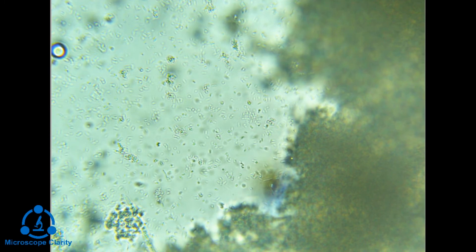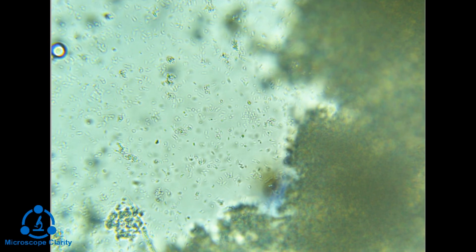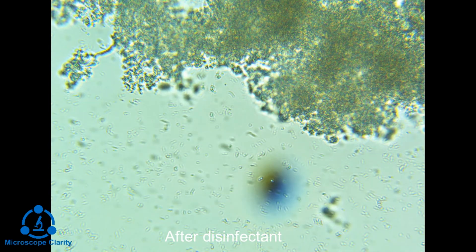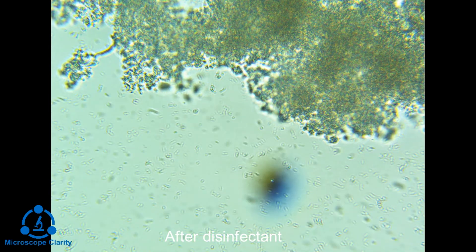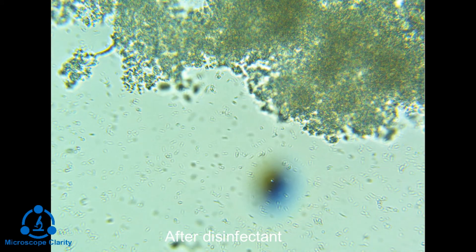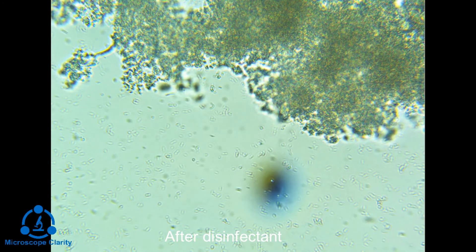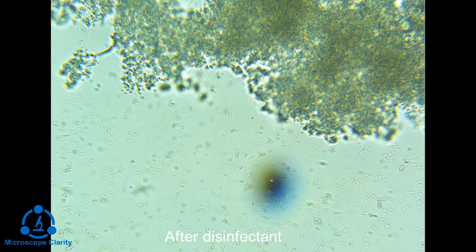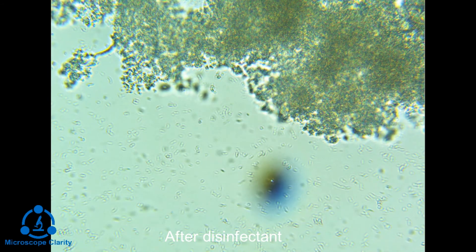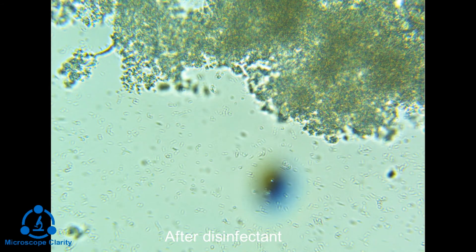Let's take a look and see what happens when we add some disinfectant to this. It does look like there's some bacteria that have just stopped moving, but there's others that I think are just moving with the current of the liquid — the disinfectant — that we've added. So it's hard to really tell if there's any movement with those bacteria, but it does look like the ones kind of in the background are stopped.